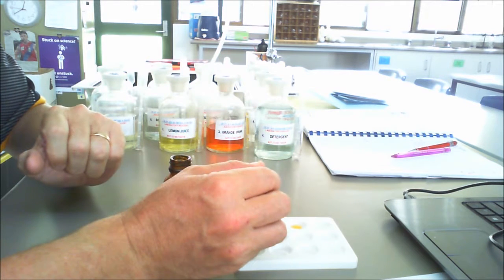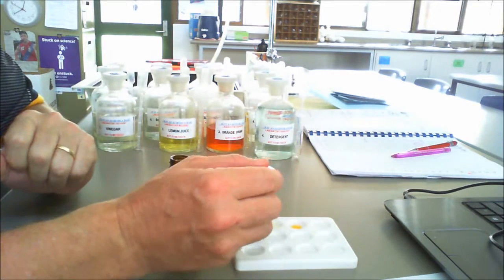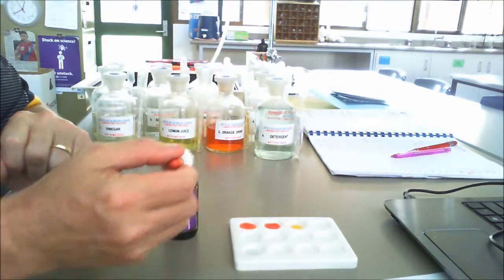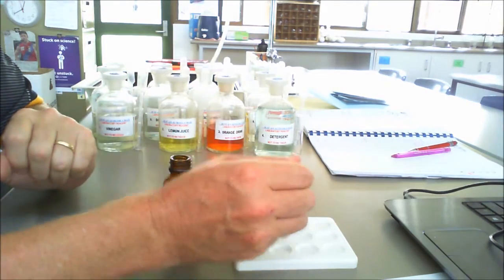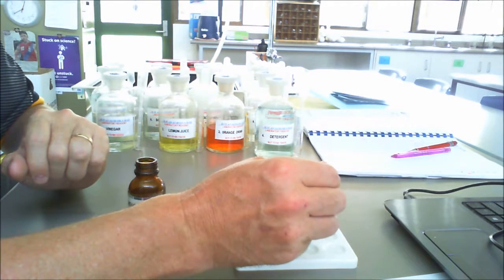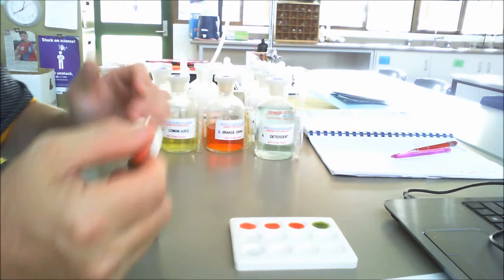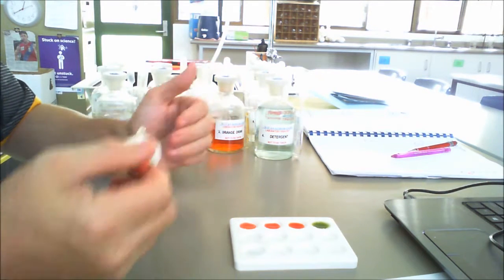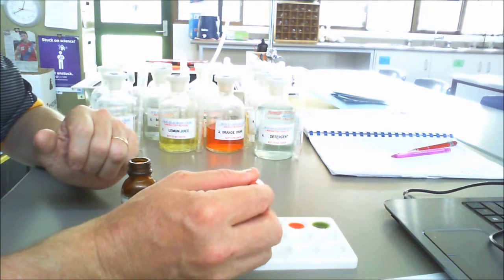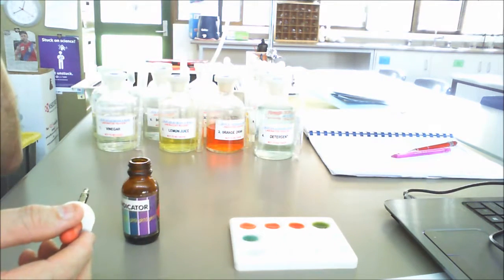So this is our first one, which is vinegar, and you can see there that it's a very nice red. Our lemon juice is also red, and our orange drink too is also basically red. Now with detergent, okay, we start to see there that it becomes a darkish green, so that's probably a base on the opposite side of a neutral solution. Then we go to disinfectant, and you see there that is a light bluish colour.